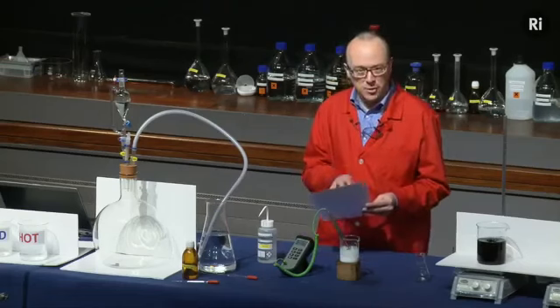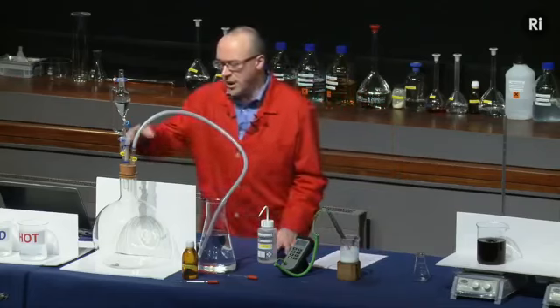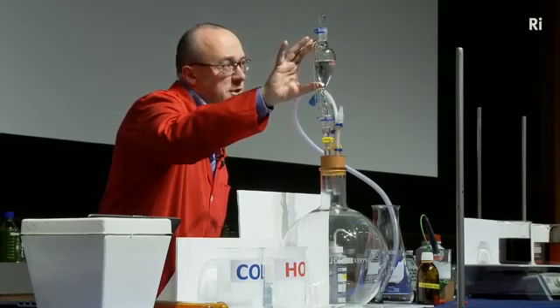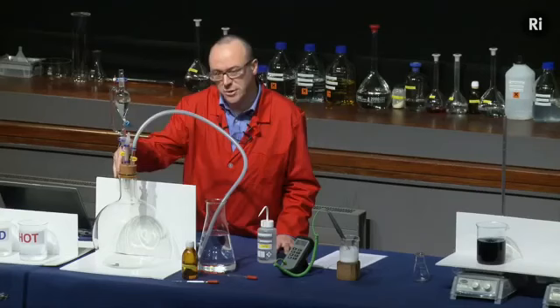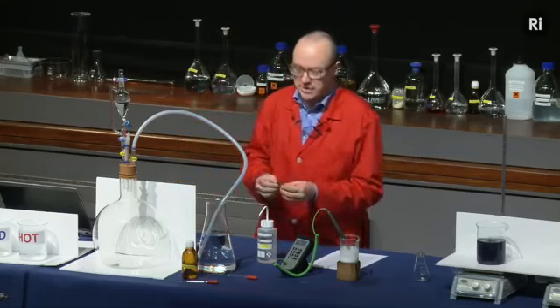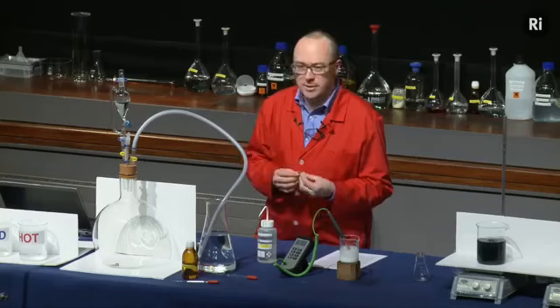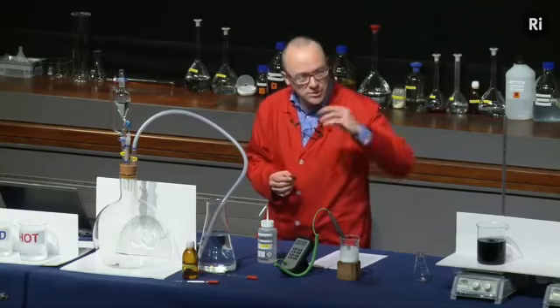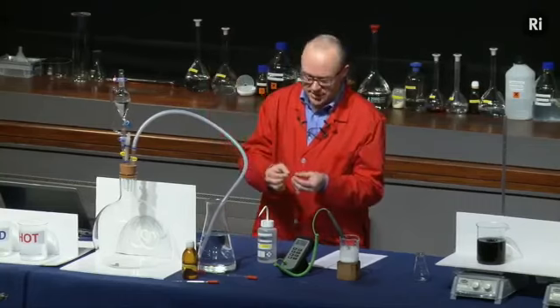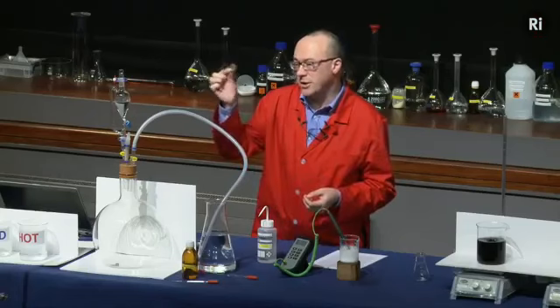When we get to the appropriate point in the story, I'm actually going to show you the reaction. And the reaction is going to happen in this flask. In this cylinder at the top, we have some nitric acid, and in the flask we have copper. Now the copper, for reasons you'll see in a moment, is in the form of a coin. We can't use a modern penny or two-penny piece because they're actually made of steel with just a thin coating of copper. So I've got an old-fashioned penny here. This was made in 1945. So this is actually made of solid copper.